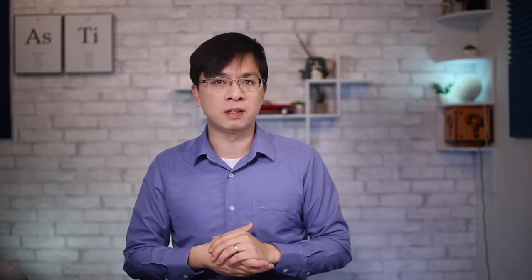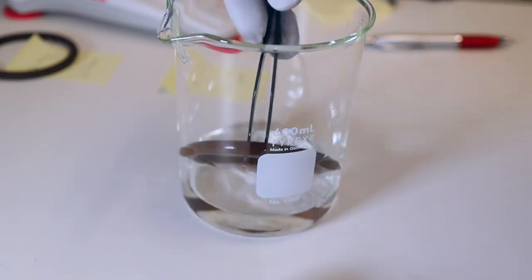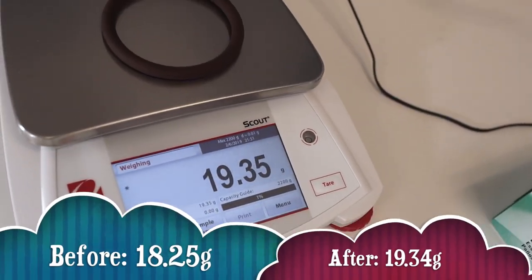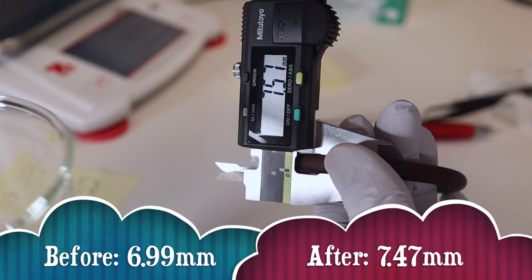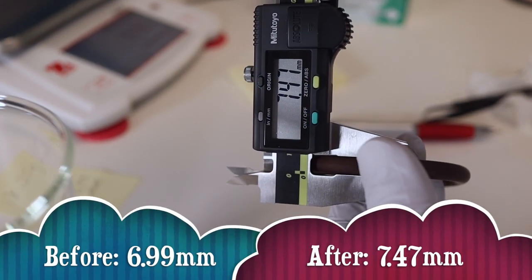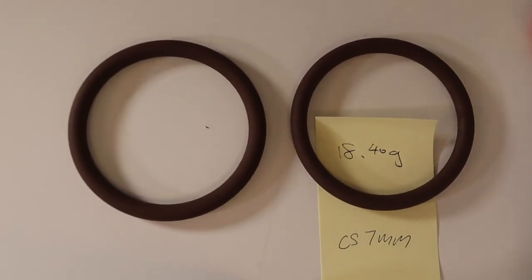We should be able to see the differences. Now we can take out the O-ring and have a measurement. This is quite obvious that the O-ring has swollen a lot. Now, compared to the original O-ring side by side, take a look.